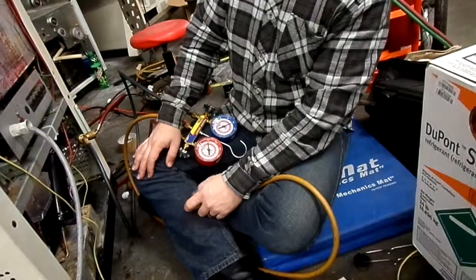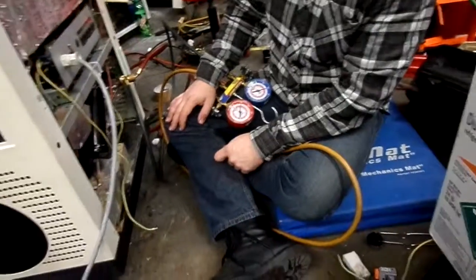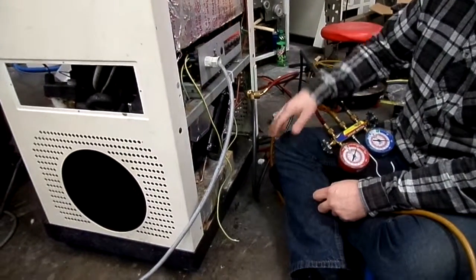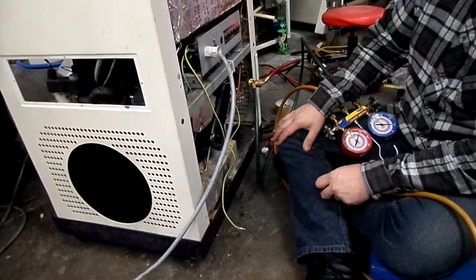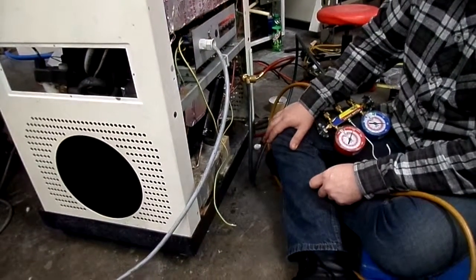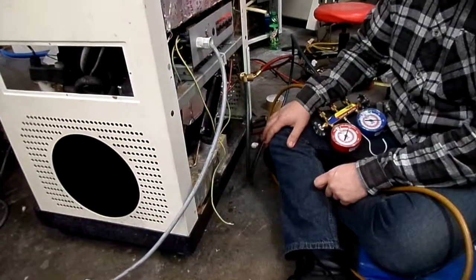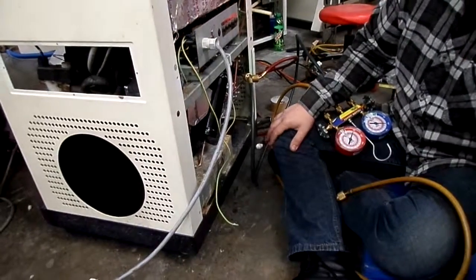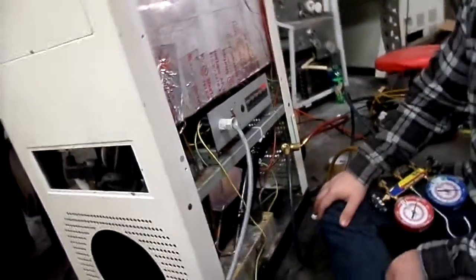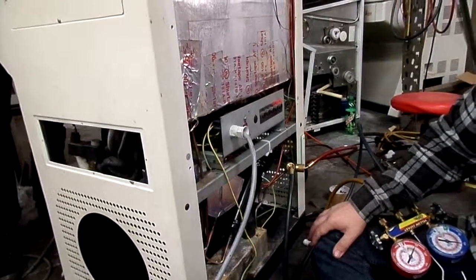If Jesse would turn the thing on. A lot of the times these machines will have a delay when you first turn them on because they don't know if they were turned on after 6 months of being off like this machine, or if it just turned off and there might be some irregularities in the pressure in the system, so we have to make sure that it's going to be safe. Come on.